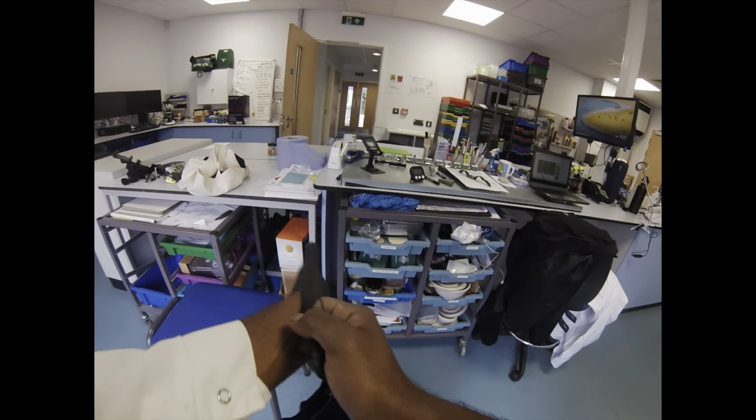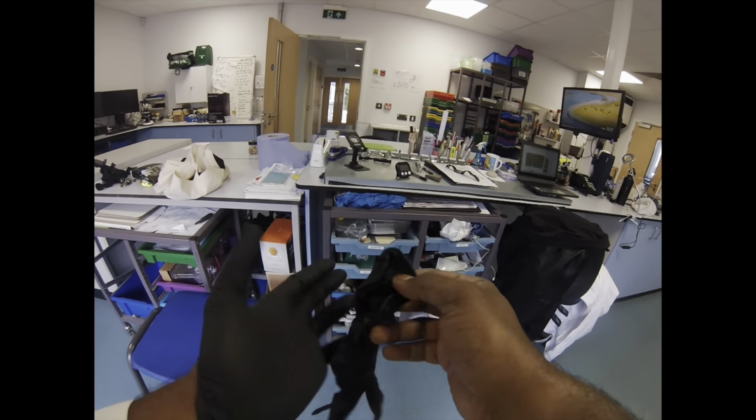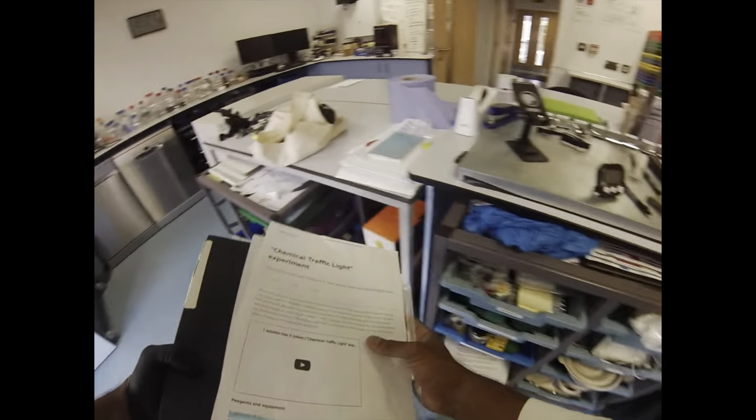We're taking some of the skills that we've already learned and combining them together. We're going to employ some really nice techniques and make this absolute crowd-pleasing demonstration.